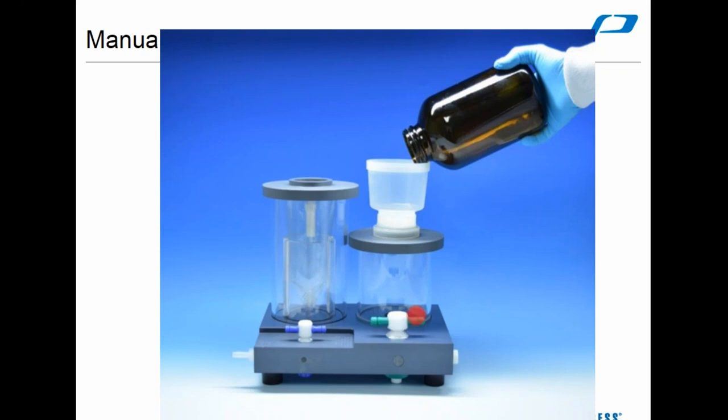The funnel with the disk, both tops are essentially the same. There's this little raised piece that the funnel base sits around. Vacuum is applied through this barb down here on the manifold. Open the stopcock here, and this is basically just a large bell jar. You pour your sample in through the funnel, and the vacuum draws the sample down through here. It all goes down into the waste, pulls out through this channel, and this gets drawn off through vacuum tubing and goes to a carboy to be collected into waste.